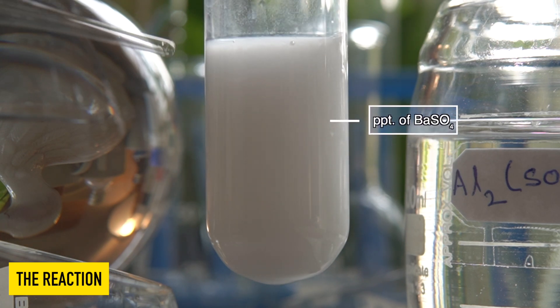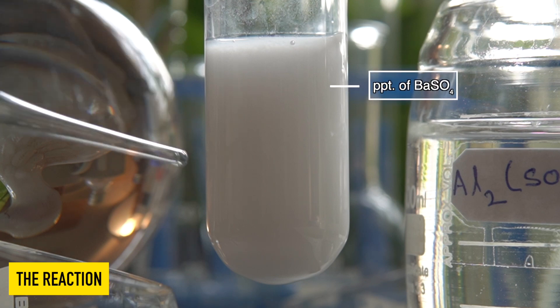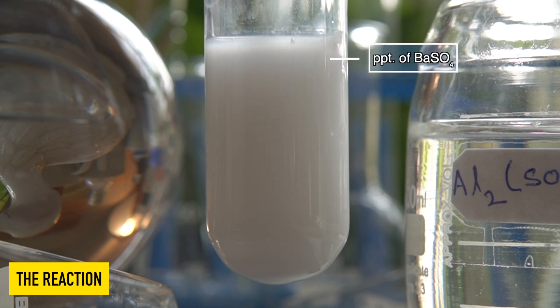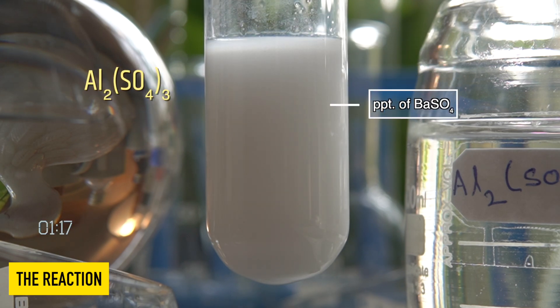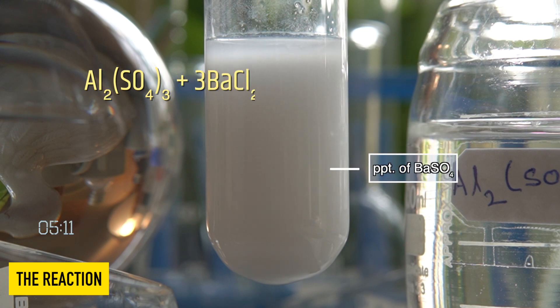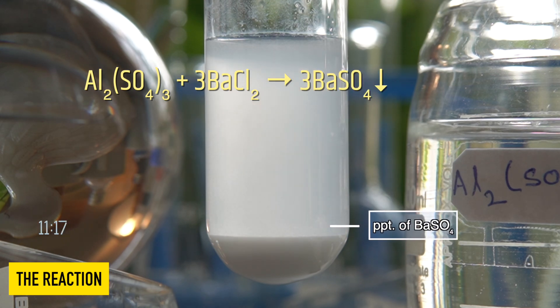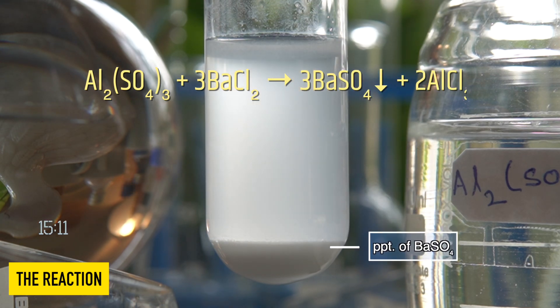The white insoluble precipitate that has been formed inside the test tube is nothing but Barium Sulphate. In this reaction, Aluminium Sulphate reacts with Barium Chloride to produce a white precipitate of Barium Sulphate along with Aluminium Chloride.